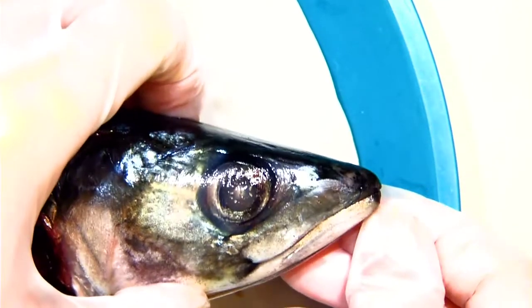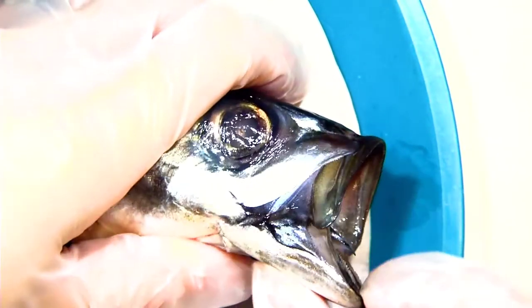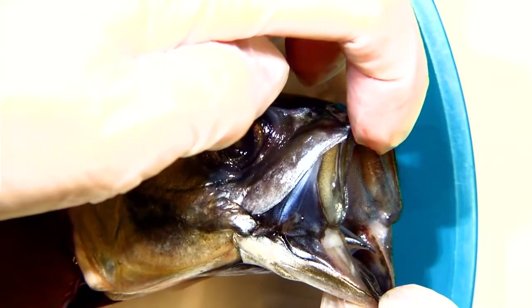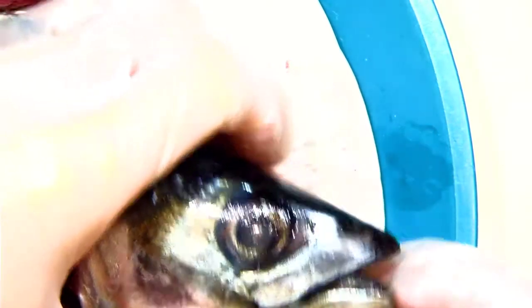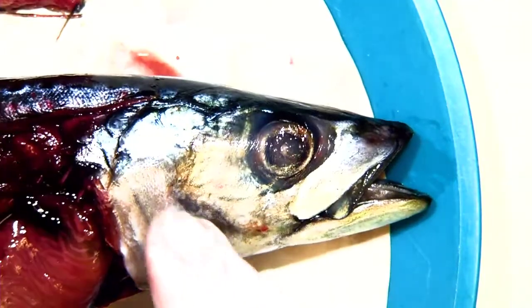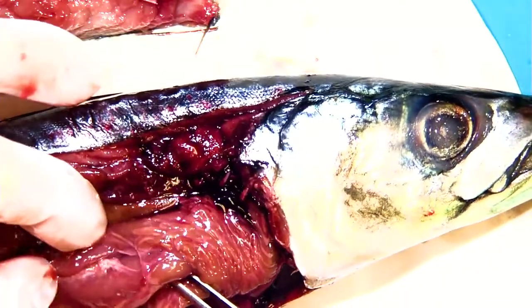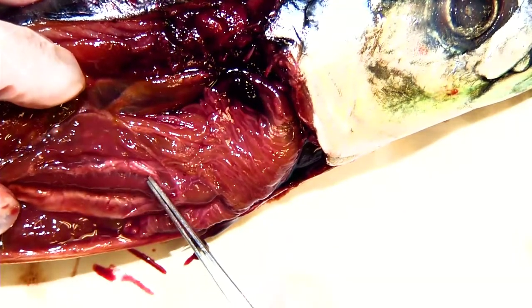Now, what about the digestive system? We know that they eat — there's the mouth. The mouth is really interesting because not only does it open like this, but it can actually open much larger. That really big mouth opening allows them to eat things bigger than you would anticipate. When very young they eat zooplankton, but this one, because its mouth is so enormous, it's going to eat small fish. After they eat, the food goes into their esophagus — kind of like a throat — and into their body. From there it goes into their stomach, right here — this tube right here is their stomach, where the food goes to digest.